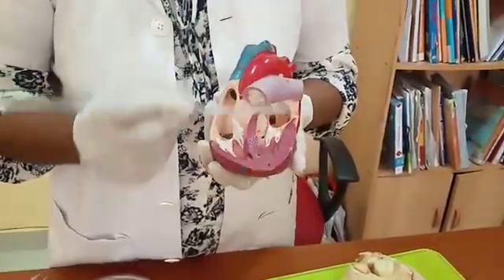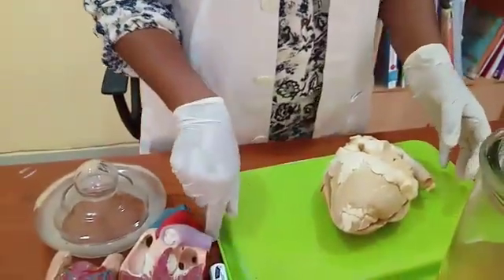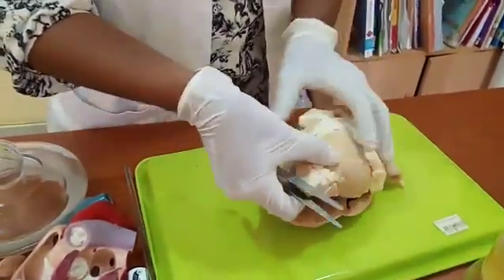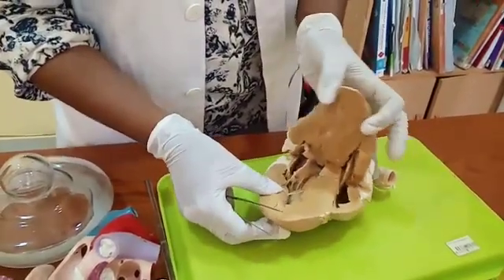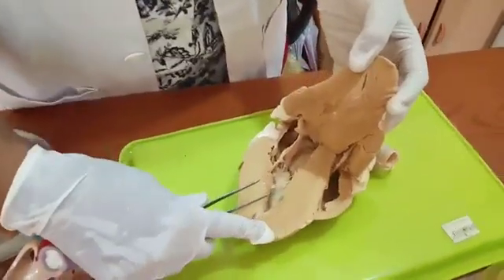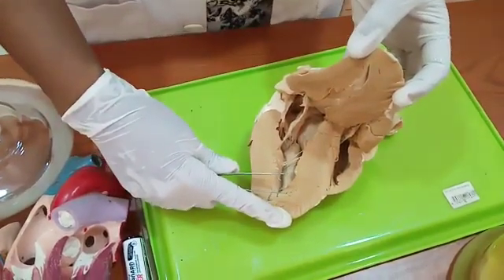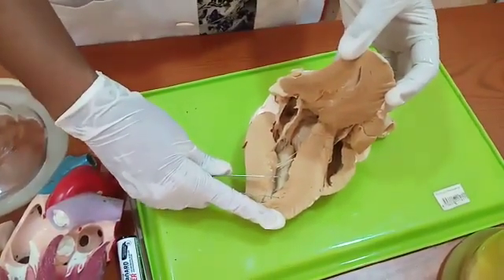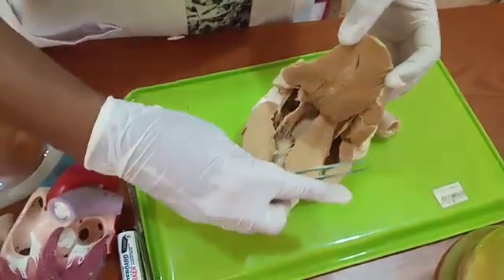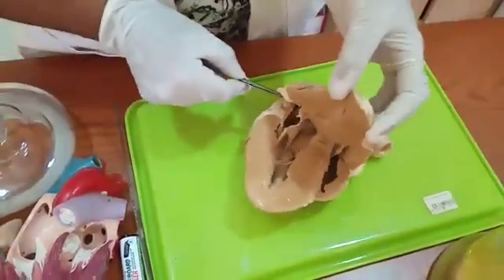Now we will see whether you can find all these structures in the real heart. I am going to open the real heart. I have done a dissection. These are the chambers you can see in a real heart. But when you see the real heart, you can see it's not exactly the same as the model or the diagrams that we learned — that's the difference. Here you can see the septum, the walls of the ventricles, and the atriums.